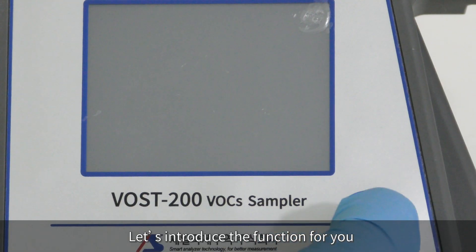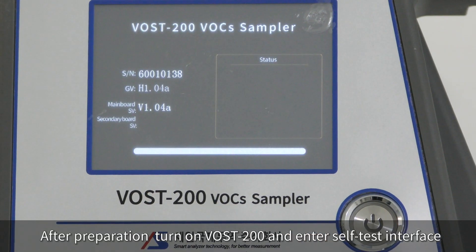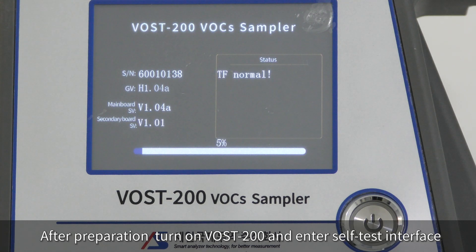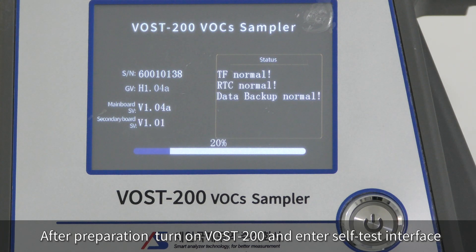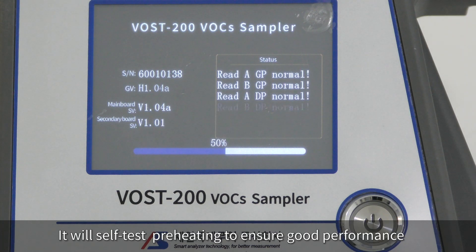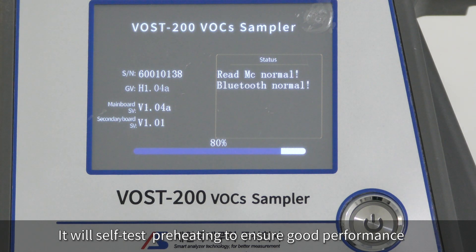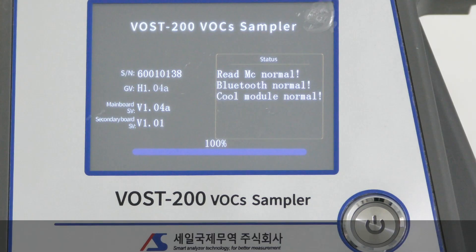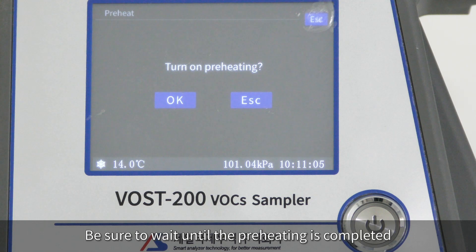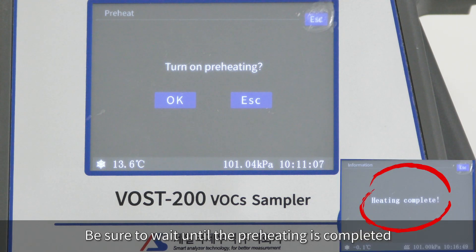Now let's introduce the functions. After preparation, turn on the VOST-200 and enter the self-test interface. It will self-test and preheat to ensure good performance. Be sure to wait until the preheating is completed.